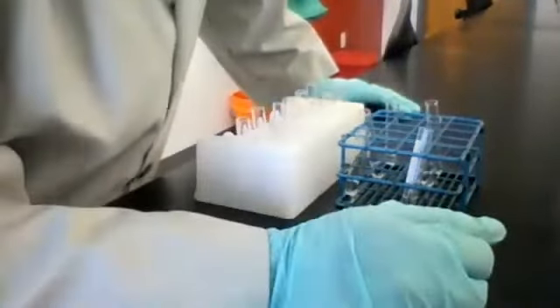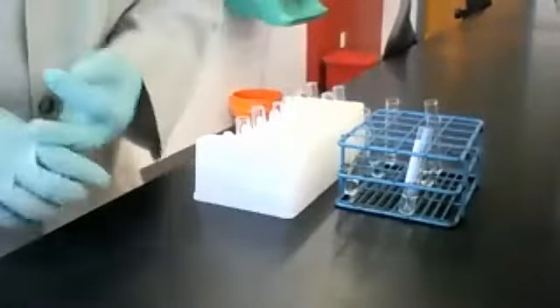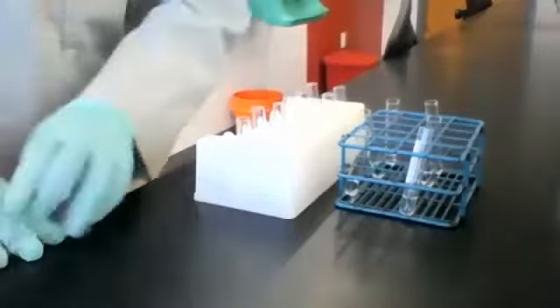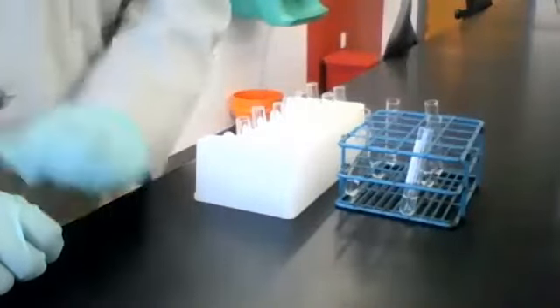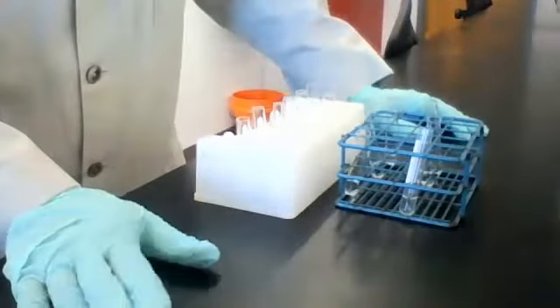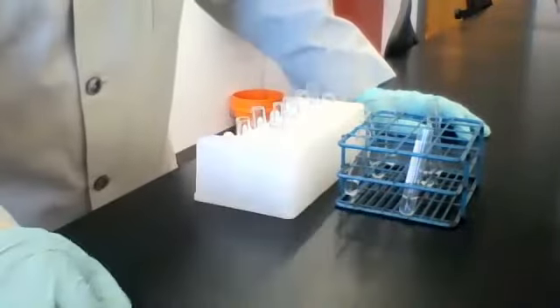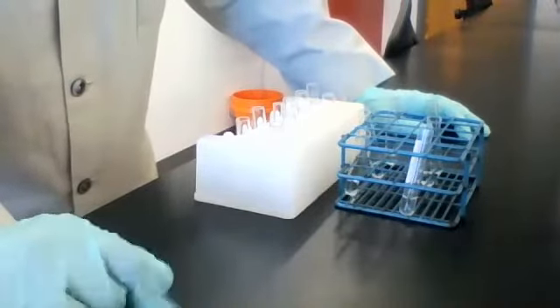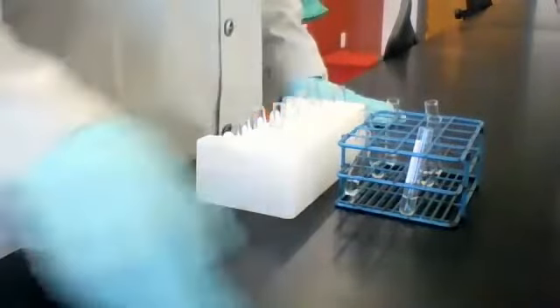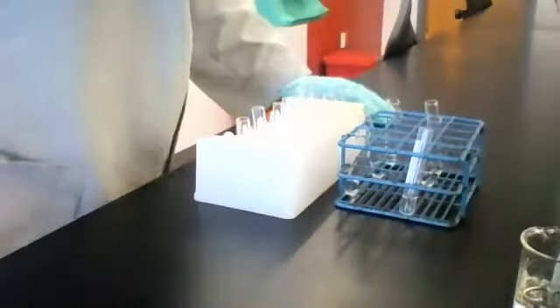And we have the same three reagents, including NaOH, but I changed the order, and I'm calling them A, B, and C. We're going to do all those experiments again, combine them just like we did before. You write down your observations, then compare those observations with the ones in the first table. See if you can figure out which reagent is which. Okay. Also, the unknown is different this time as well. So that's a fun little twist.